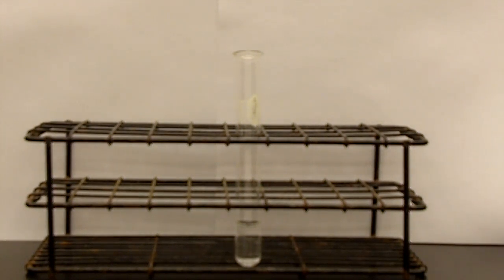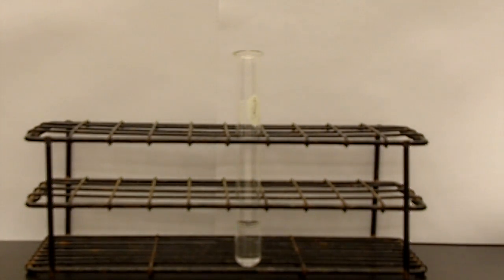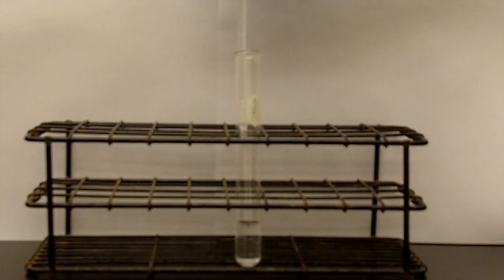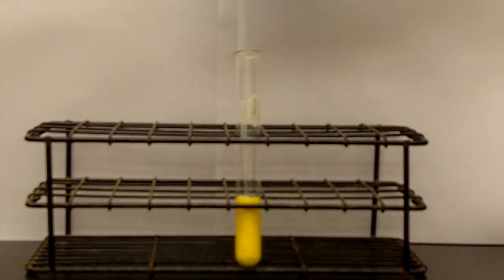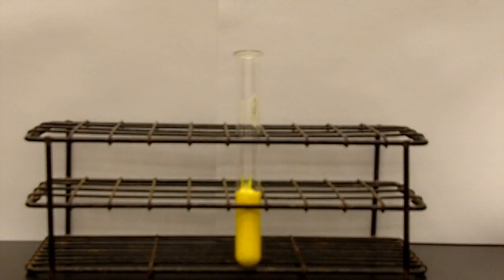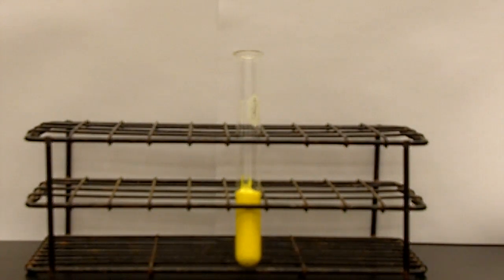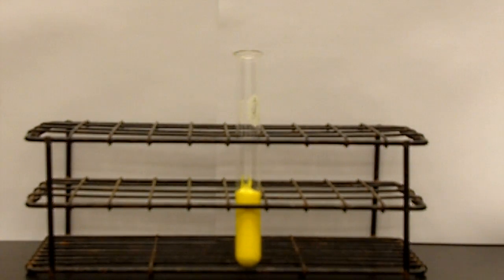Now we have a solution of lead nitrate, and we're going to add potassium iodide. Now you want to write potassium iodide.